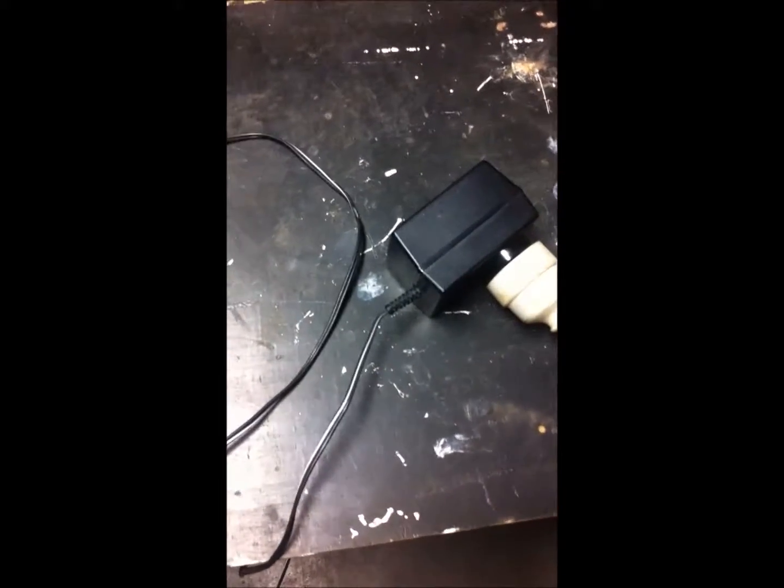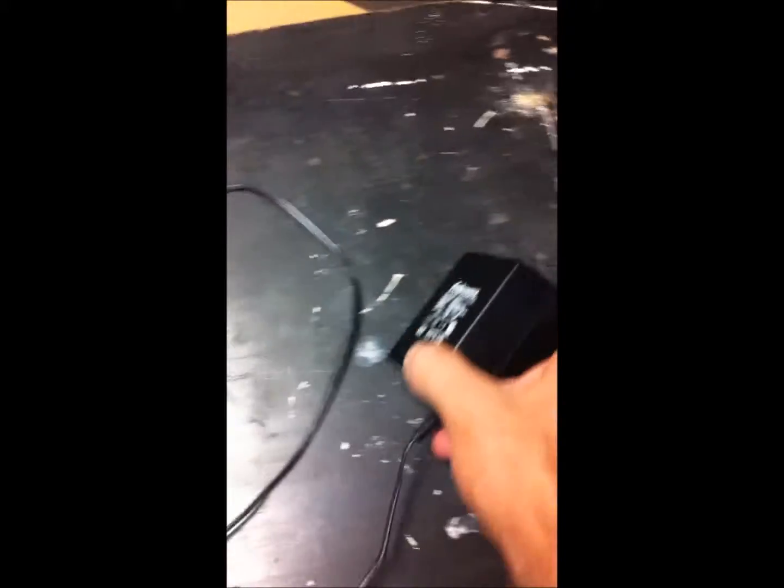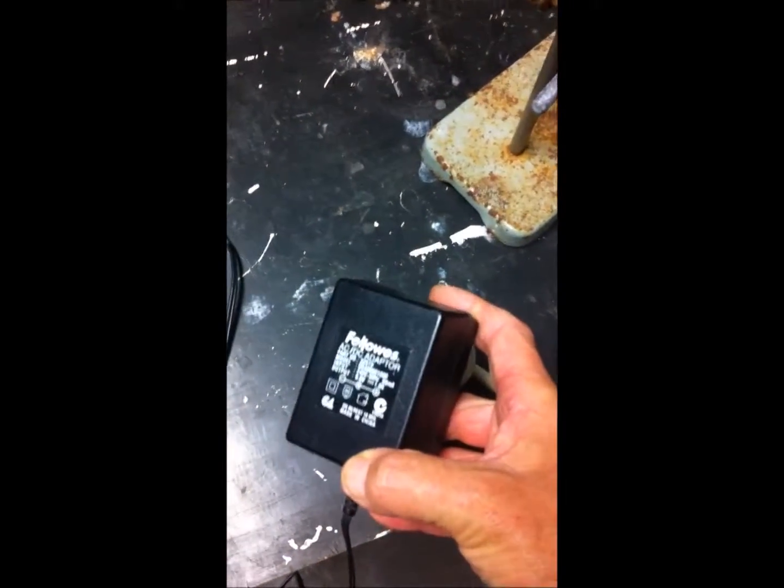At this point we look at the power supply. The power supply is a regular wall wart. I strongly recommend a visit to a local op shop or a thrift shop, as the Americans call them. You can get them for a good price. This is my slightly feral green LED to show that it's on.